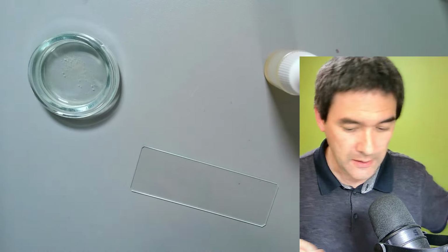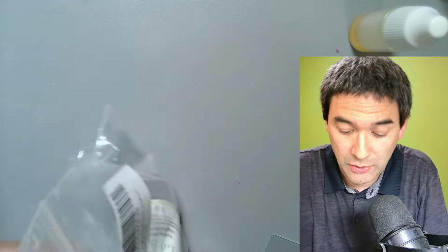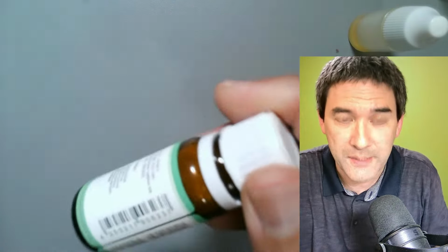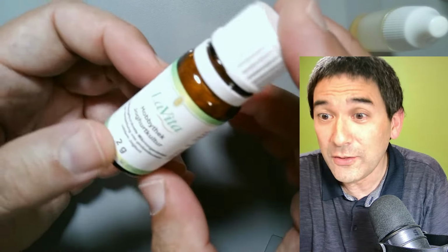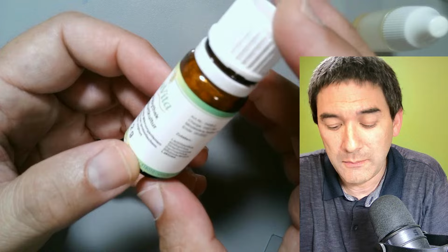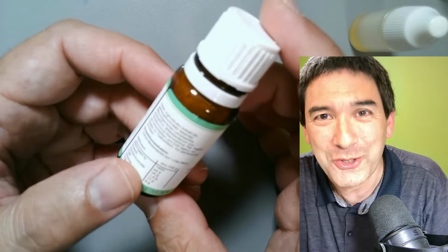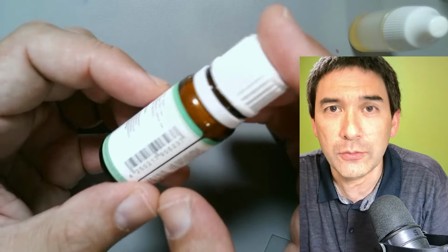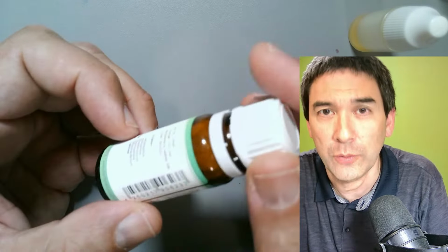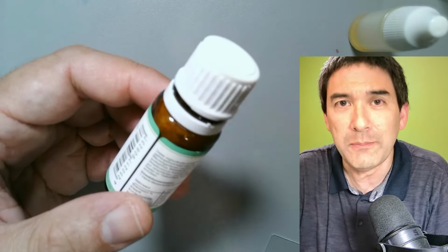Here it is. Again, I bought this here. I only want to work with safe bacteria, right? So I bought myself some time ago this bottle of bacteria for making yogurt. This basically contains bacteria which are not dangerous, right? The bacteria are freeze-dried. This means it's a bacterial culture which was frozen and then vacuum was applied to take away the water. So that's a way of preserving bacteria.